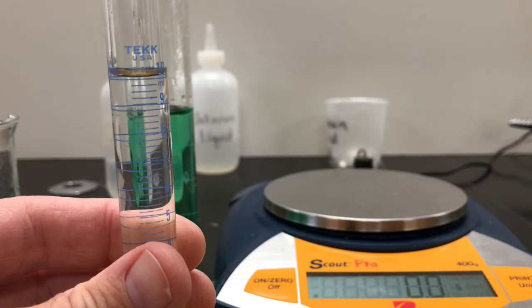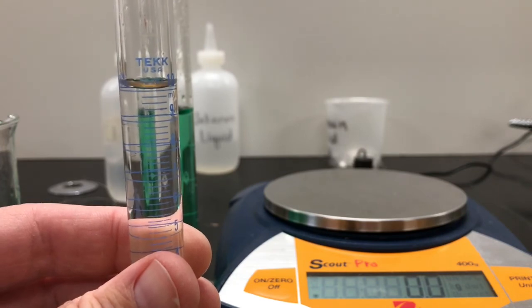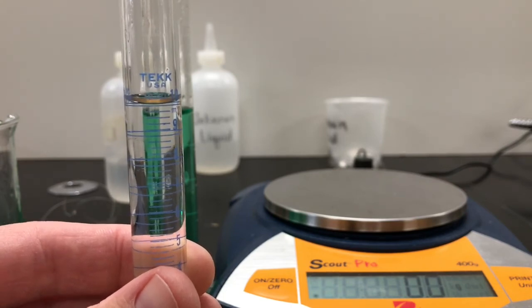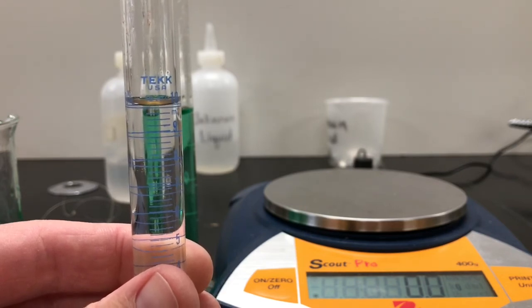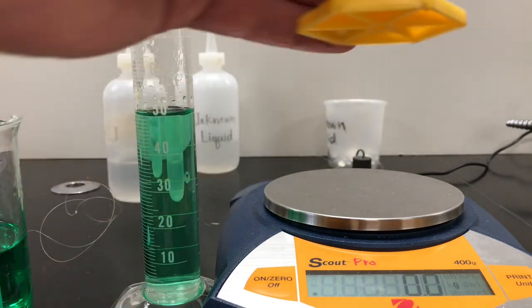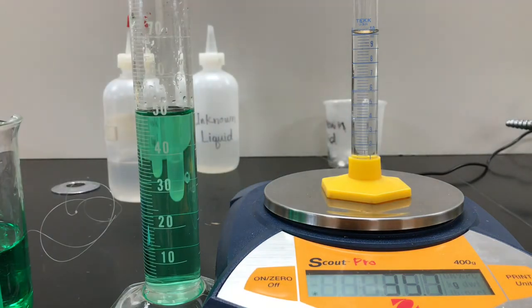Now, you'll see kind of like a curved, kind of shadowy area at the top of the liquid. That's called the meniscus when it kind of has some curvature in it, and you read what we call the bottom of the curve. So the bottom of that curve is definitely right at that 10 line. And so now that we have 10.0 milliliters, that's going to be our volume of liquid, our volume of alcohol. And when I put this on here, the scale rises. We're now at 35.7 grams. I should have re-zeroed it before I put it on there, but I did look and the scale was still at 0, so I'm confident in it.